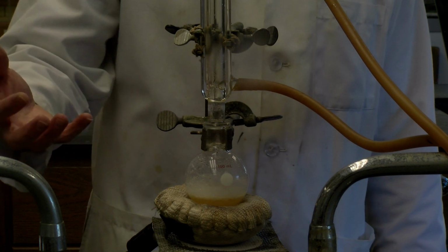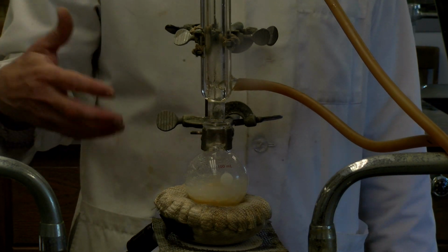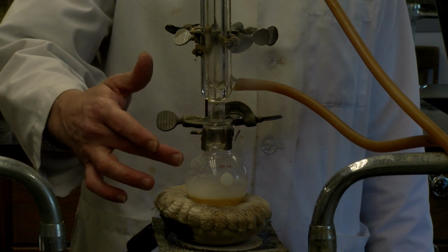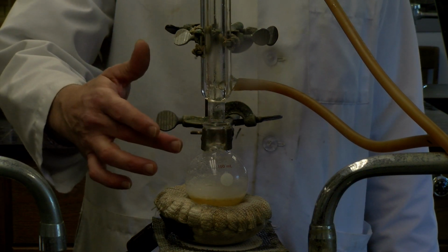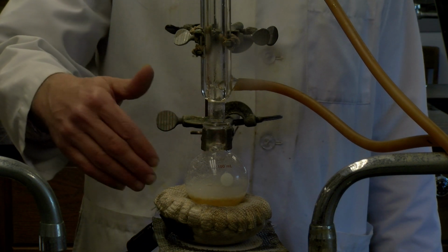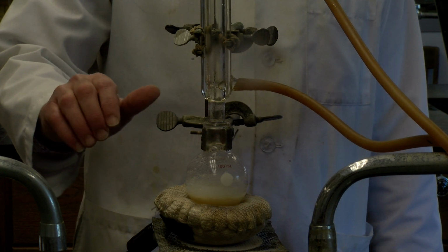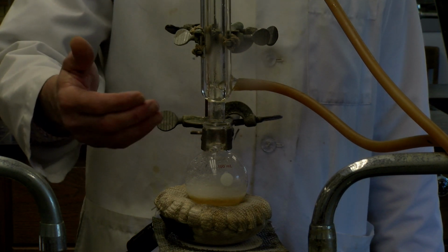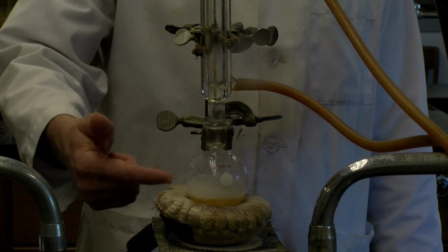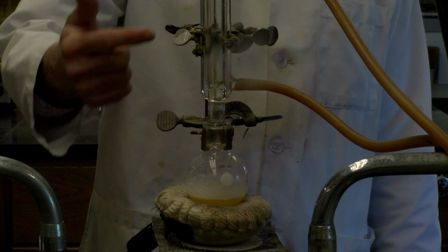You might remember back to the Percy Julian video, and in there they talk about adding a little bit of heat gives the bonds energy, allows them to break. And that's really what's happening here with the maleic acid in the cis conformation. We've added the HCl. The HCl helps that double bond break temporarily. The molecule switches into the fumaric acid and then reforms. And it does that, in this case, by giving heat and acid to have that occur.